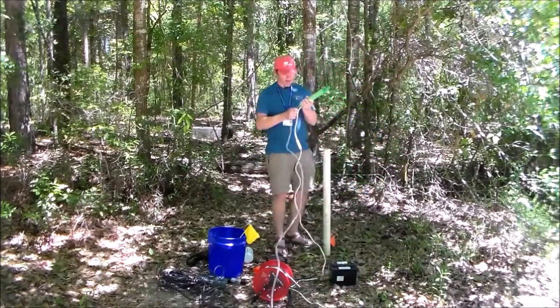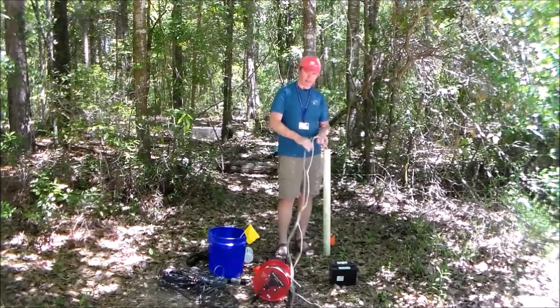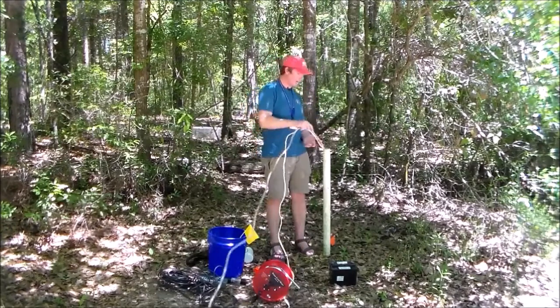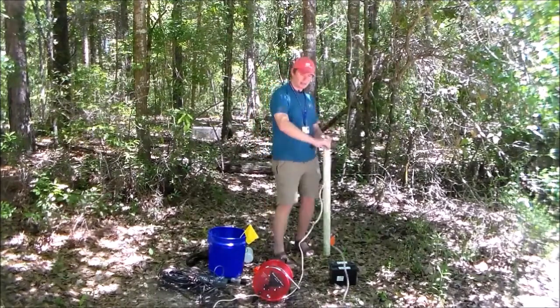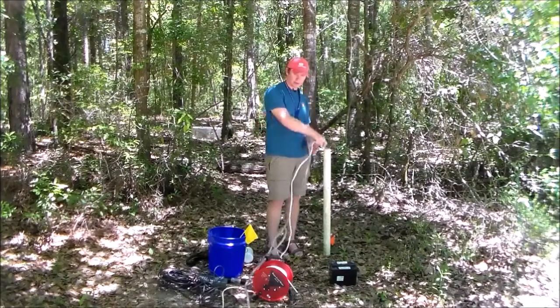Put these two together and drop this thing down. Now, while it's going down, I want to say that this is the ideal setup for a pump. Typically, we want to pump water upwards as opposed to trying to suck it up to the surface. There are pumps that will allow us to pull water to the surface, so we could leave the pump on the surface, in other words, and kind of suck the water up like you're sucking through a straw or something.